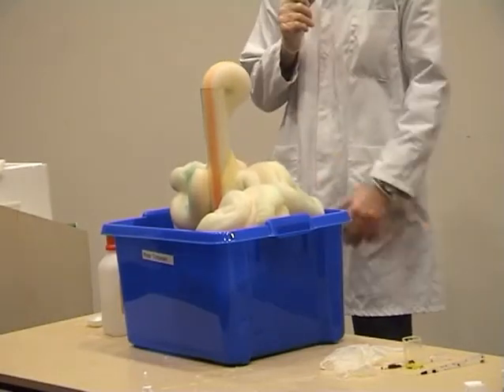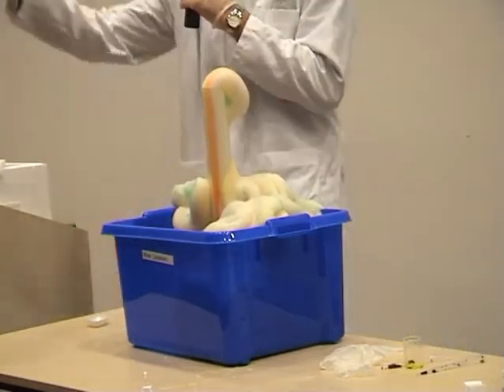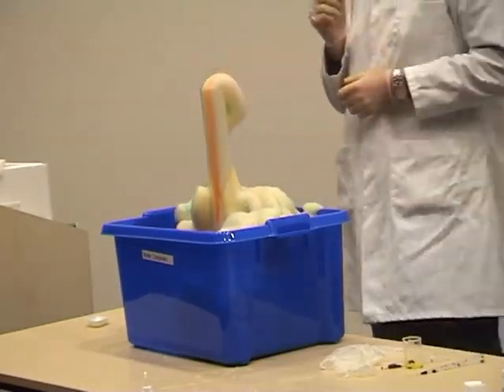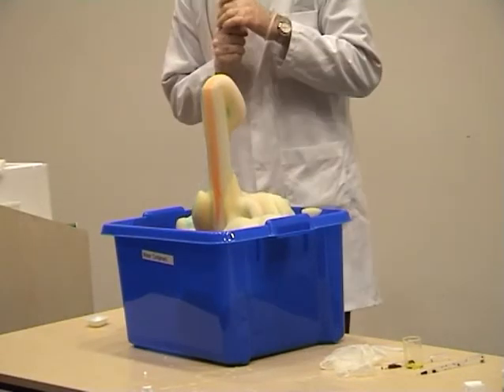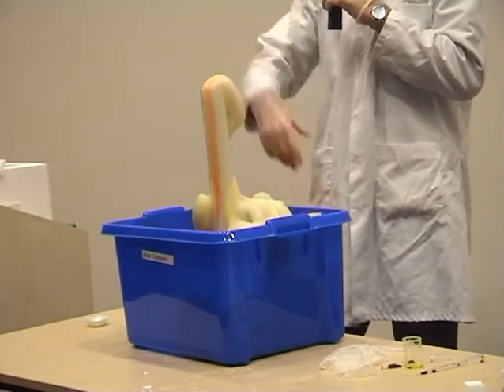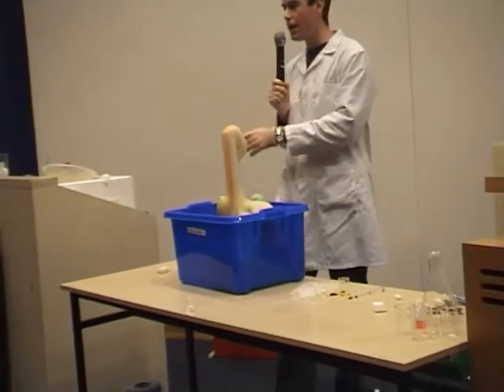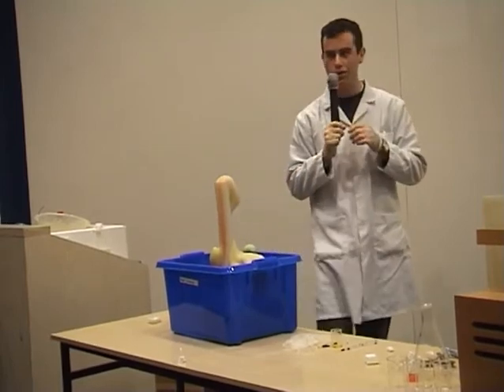As I said before, we had hydrogen peroxide, and we added that to each graduated cylinder, and then we added some washing up liquid. The purpose of the washing up liquid was to capture the oxygen as it was released during the reaction. With just washing up liquid and hydrogen peroxide in the graduated cylinder, nothing happened. But when I added this stuff along with Colin and John, the reaction shot up. What we added was potassium iodide, and that was the catalyst, and it sped up the reaction. I'm now going to hand you over to Colin.